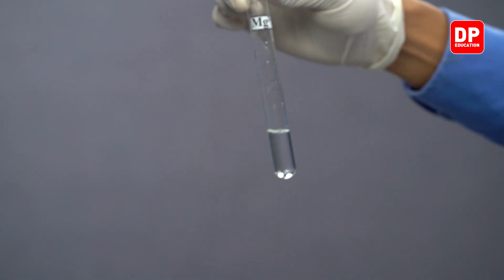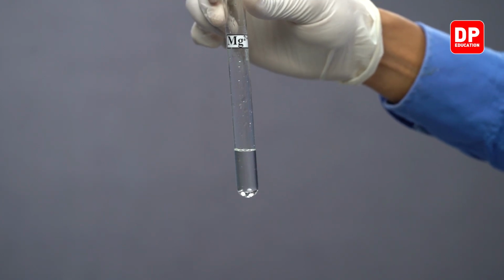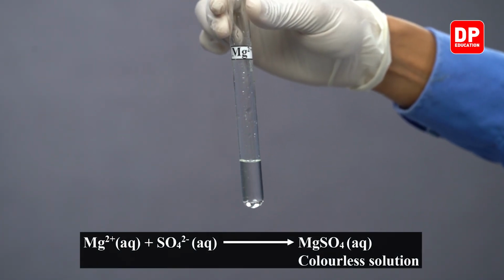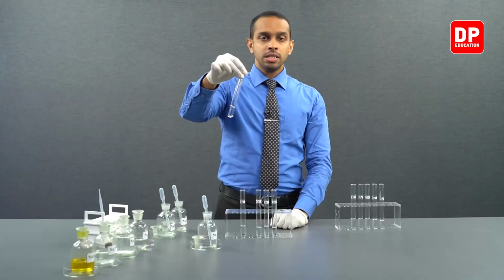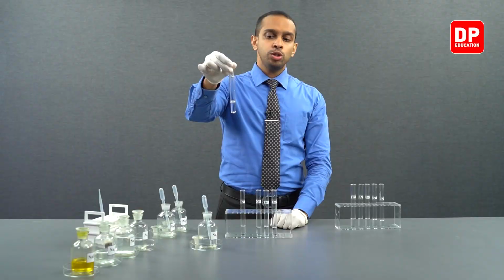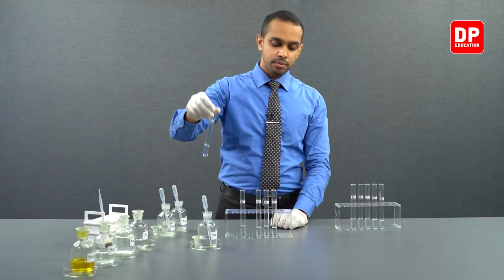In the presence of magnesium ions, sulfate ions will form magnesium sulfate. Magnesium 2 plus and sulfate ions will get together and will form magnesium sulfate. Magnesium sulfate is soluble in water. So therefore, you will not see the formation of a precipitate.